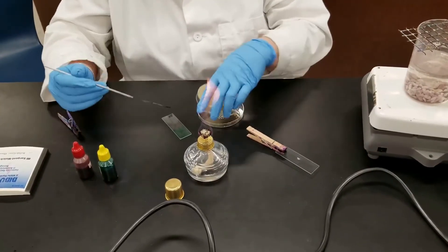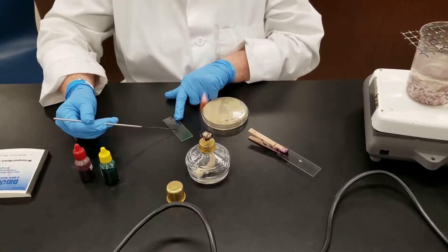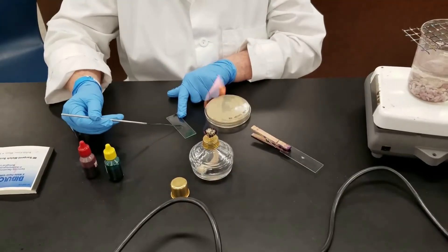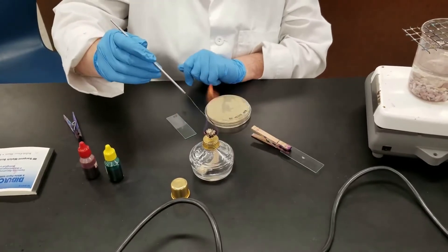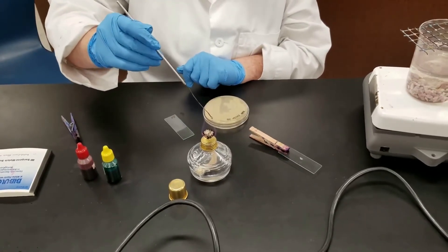So here we're doing our smear. I'm going to flame my loop. We always flame before and after.